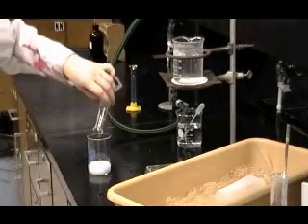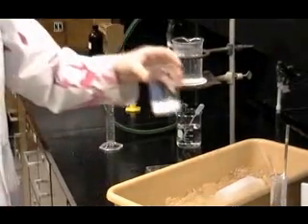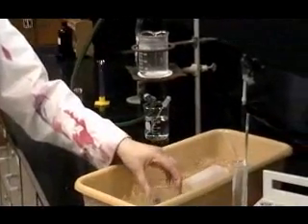The beaker should remain packed in ice for at least 10 minutes. During this time, the cloud of white aspirin crystals should grow to fill nearly half the volume of the beaker.